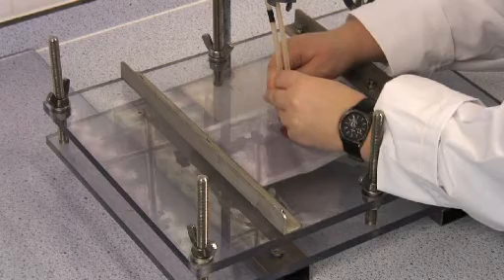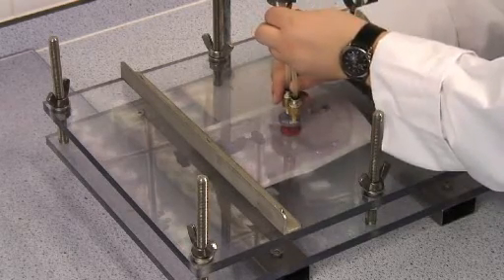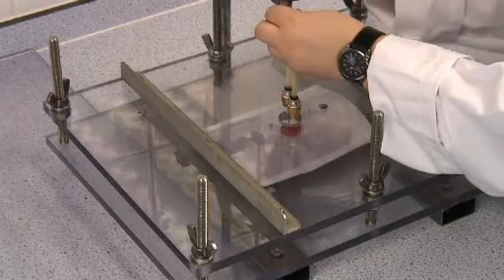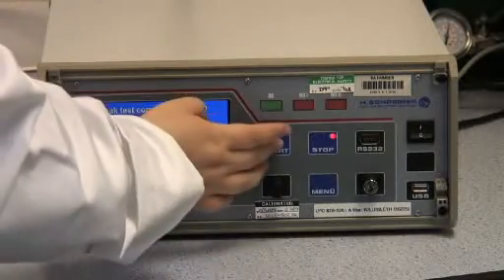The pack to be tested is placed between restraining plates. The needles from the compressed air line are inserted into the pack via a septum.